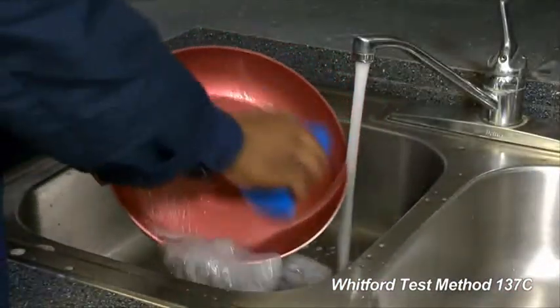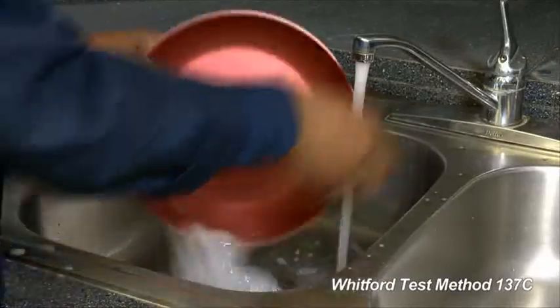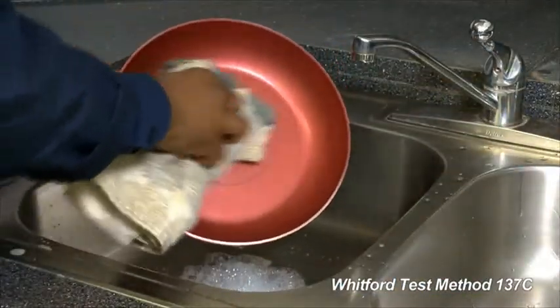Drain the oil. Use warm water and a mild detergent to wash the pan. Then blot it dry.